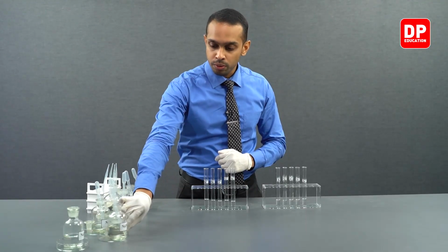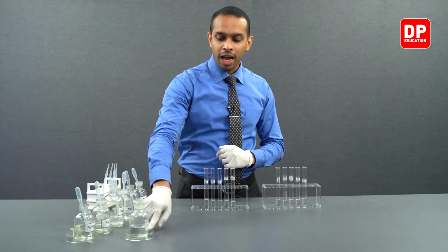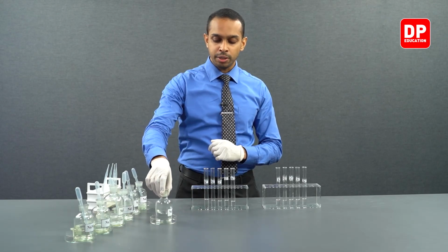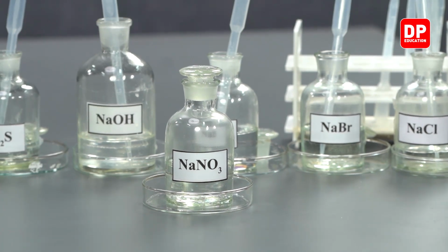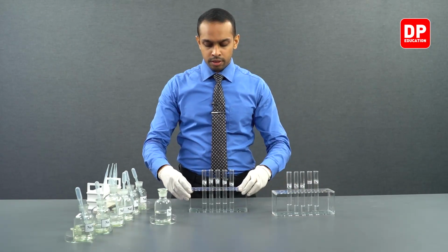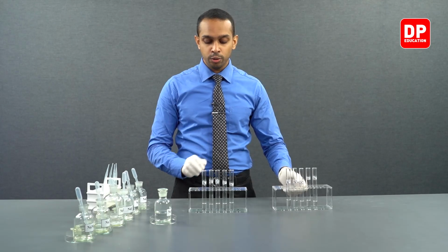Let's move on to nitrate ions. So we have our sodium nitrate solution here. Using this solution, we will introduce nitrate ions into our cation solutions. Let's take new samples of each of our cation solutions here.